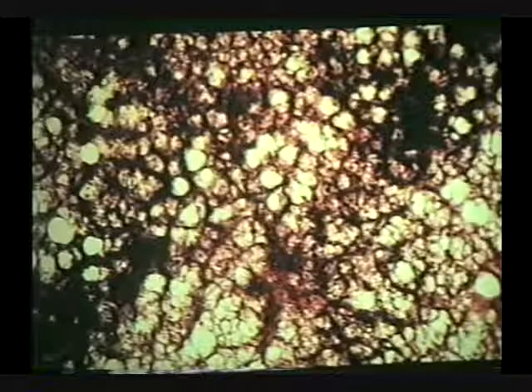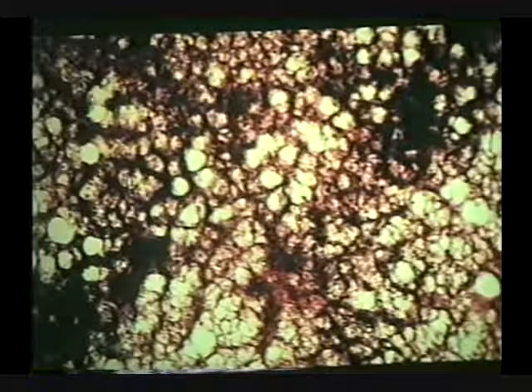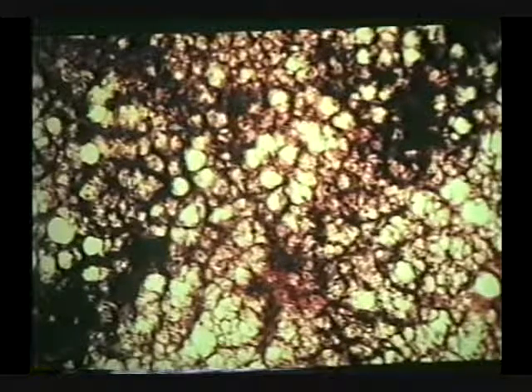This is emphysema — carbon particles from smokers. These are not alveoli; each one of these is dozens of alveoli coalesced into a big, useless dead air space, and it's all crammed full of carbon particles.